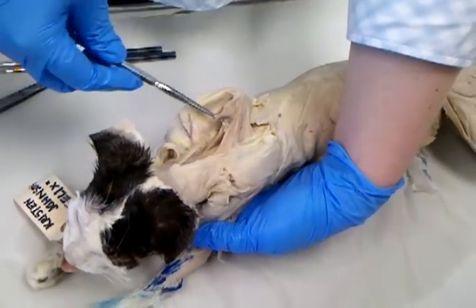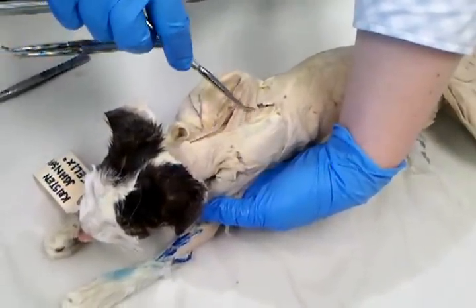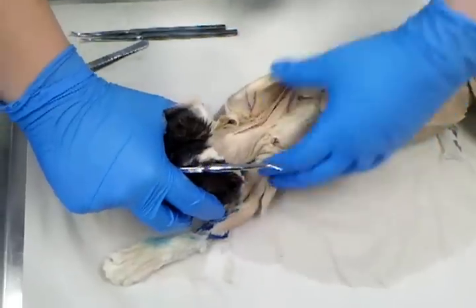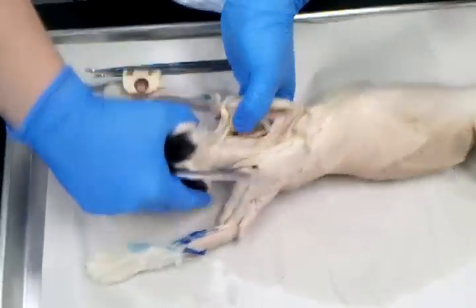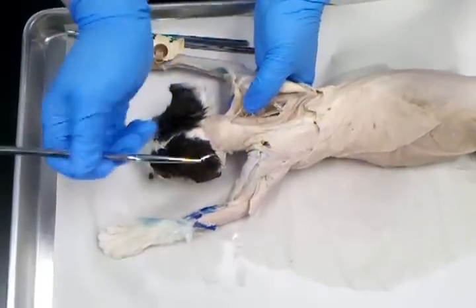Okay? And it's coming down from the head and attaching to the bottom edge of the scapula. Okay? Now, all these other muscles that attach to the bottom edge of the scapula, that's just all rhomboideus. Okay? Now, if I move the rhomboideus capitis out of the way, all these neck muscles on the side, right here, lying on the neck, that's all splenius. Okay?